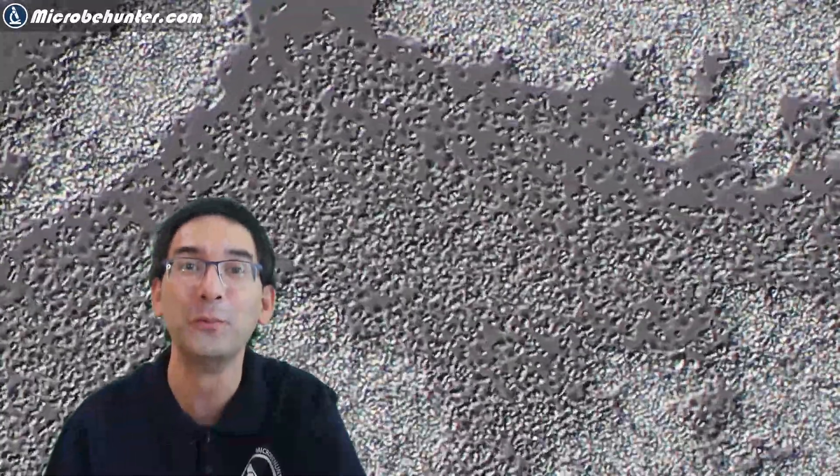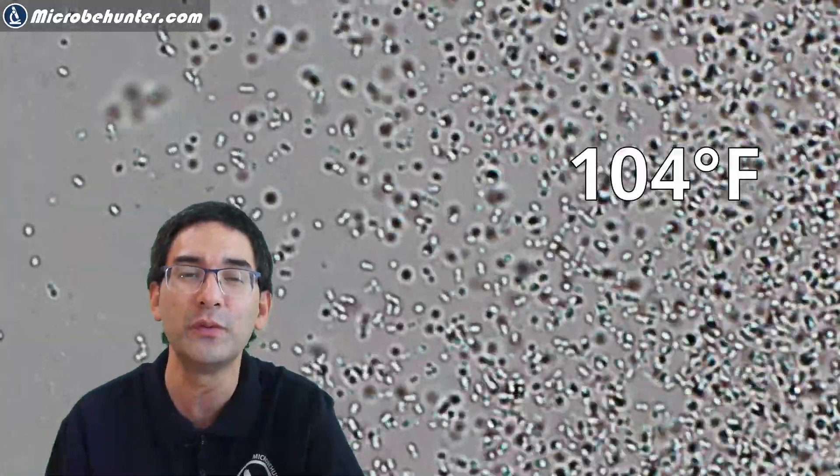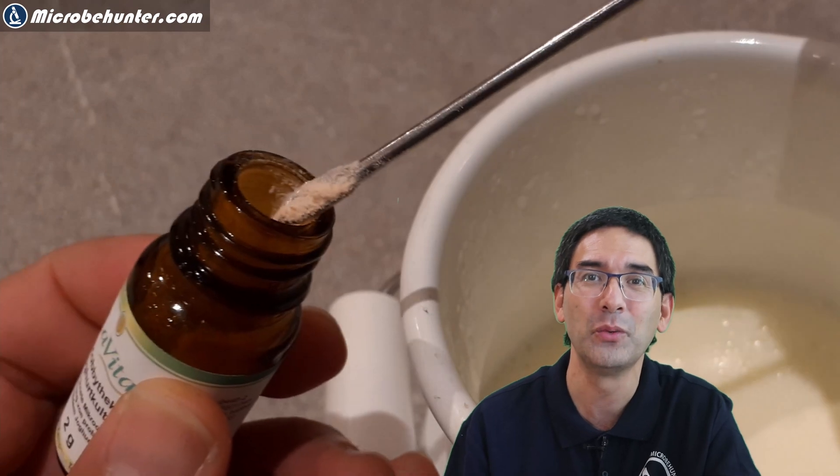It takes a little bit of time. I'm showing this while we're waiting for the hot milk to cool down. The optimum temperature is around 41–42 degrees centigrade, which is around 104 degrees Fahrenheit. Here again we're in bright field, still waiting for the milk to cool down. I re-suspended a knife tip of the freeze-dried yogurt culture. What you can also do, of course, is take some freshly made yogurt and add that to warm milk — it also works, that's the normal way to do it. But if you want a very highly concentrated yogurt bacteria sample under the microscope, you actually want to look at the powder.